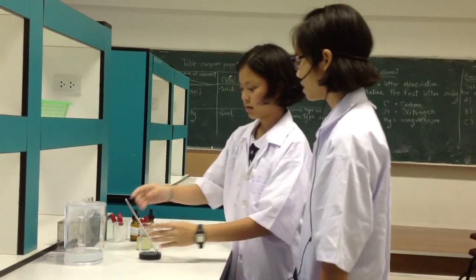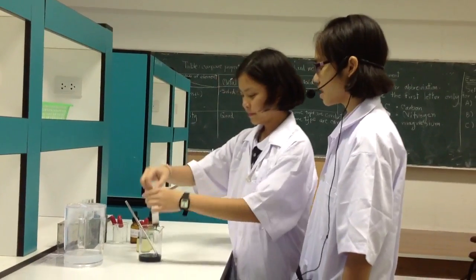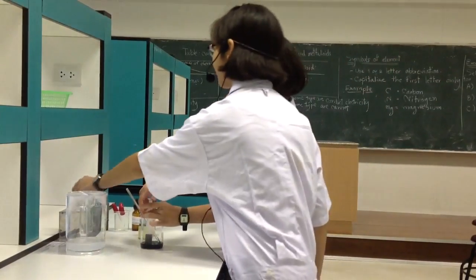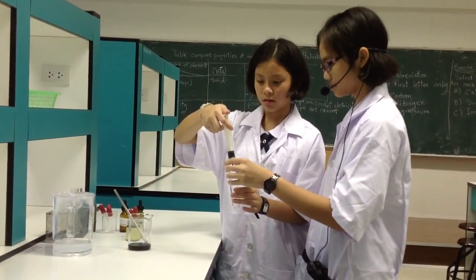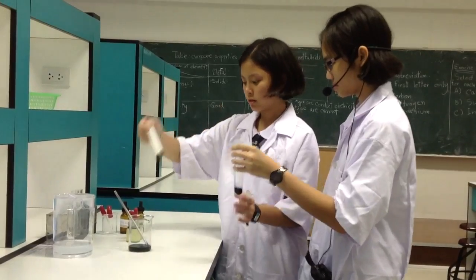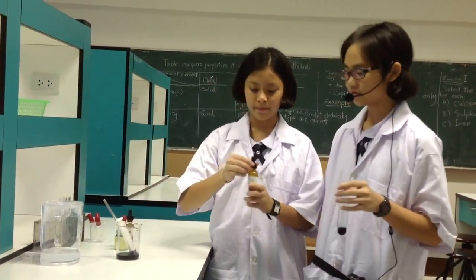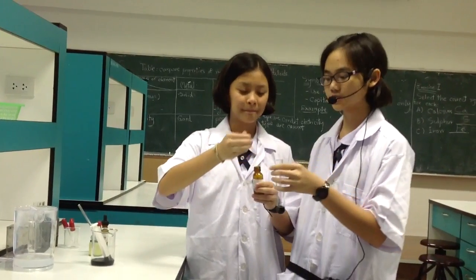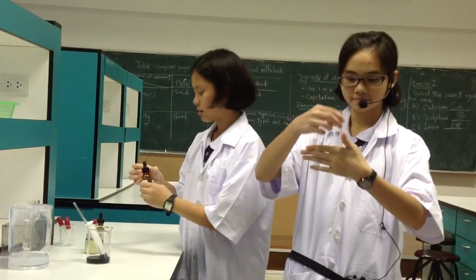Step 2: Add 5 cubic centimeters of the testing solution into the test tube. Drop a few drops of the ascorbic acid solution into the testing solution. One drop at a time. Check it.